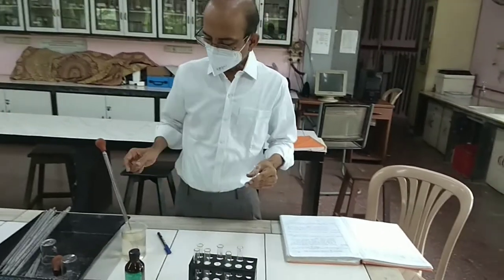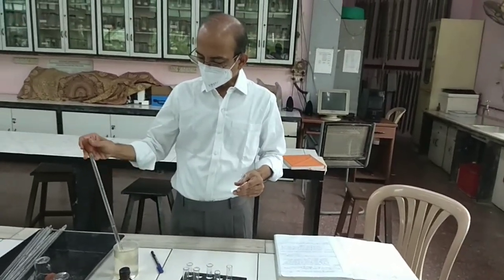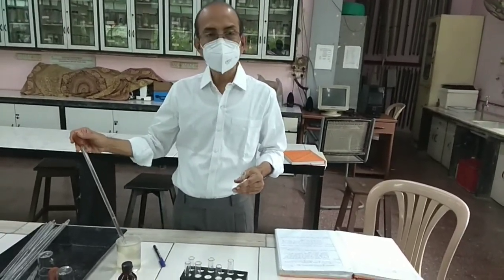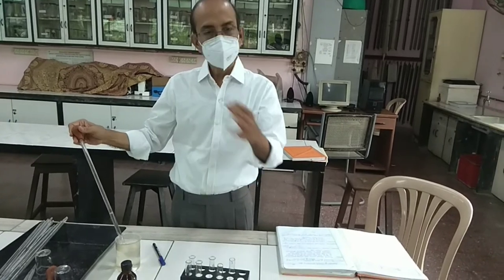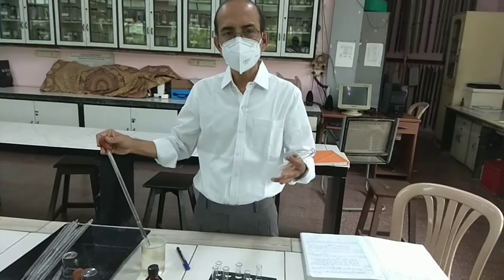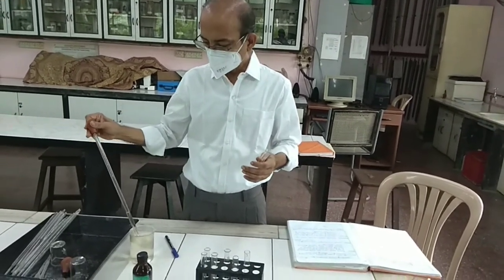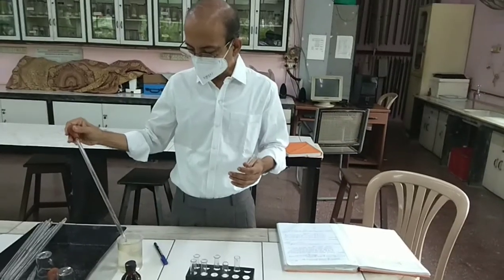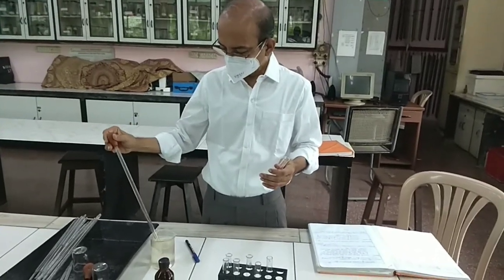Here I have pond water in which some fish were kept. You can keep the fish in any pond water for about an hour or two — they will excrete. And then we will take out three ml from this.